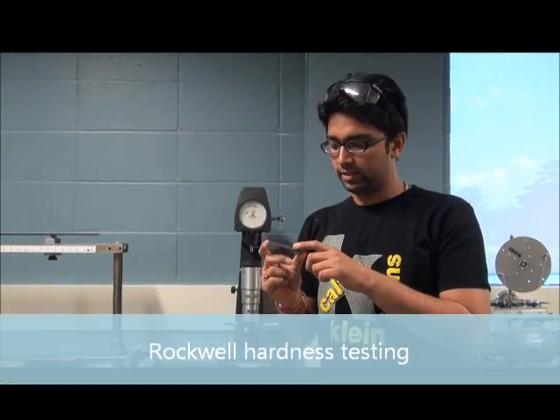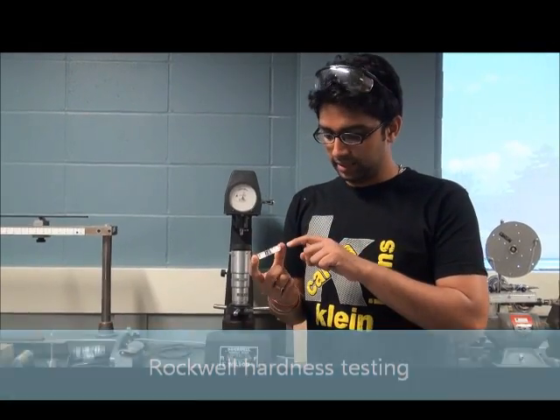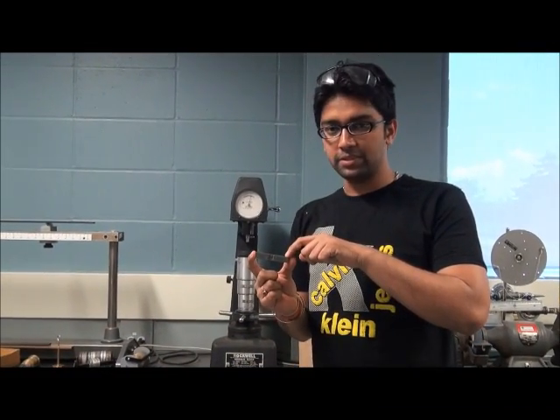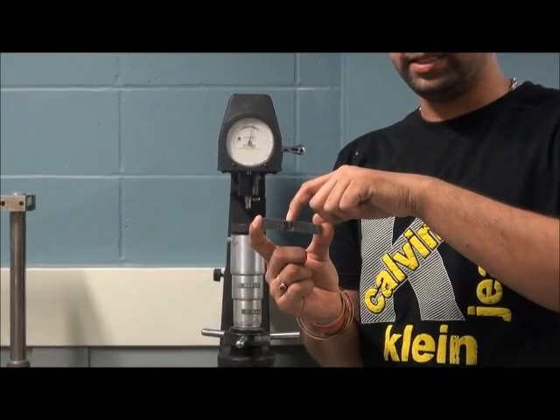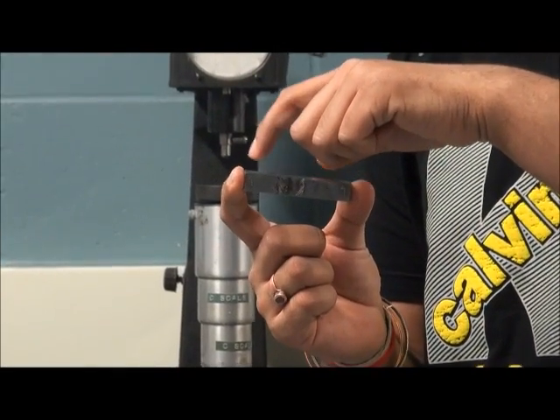After using our sample, we have to check the hardness of five different zones. This is the low carbon sample. We have checked the base metal, the heat affected zone, the weld zone, the heat affected zone, and the base metal.